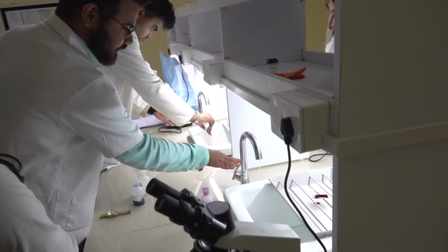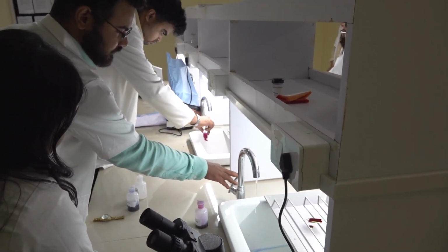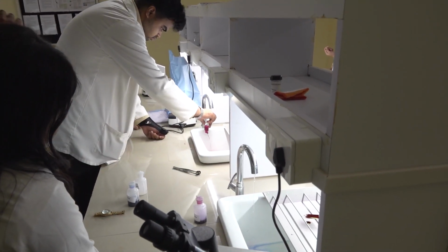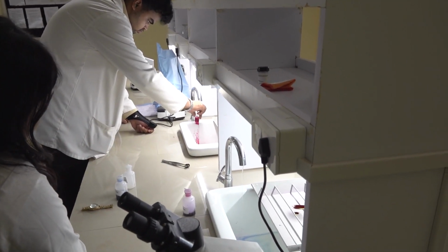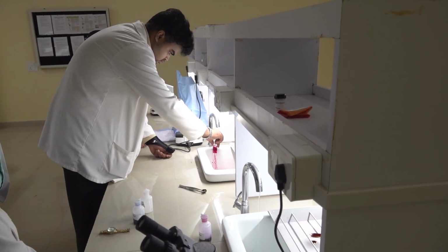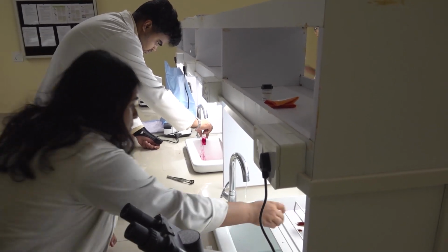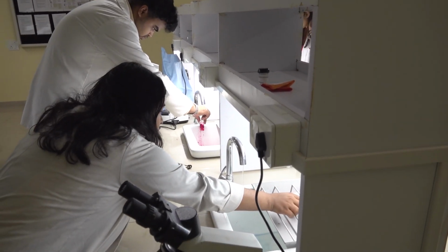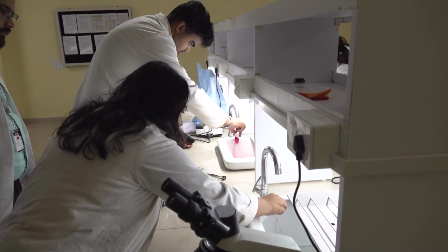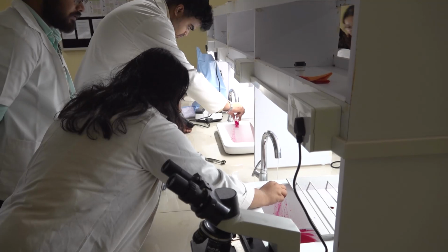पहले पानी start कर लेना. Smear red color है. Your finger should not touch the smear.